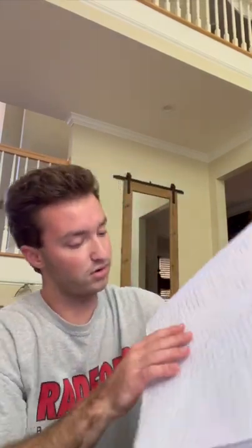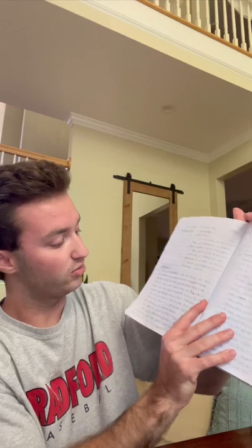And I wrote that this reaction was a precipitate reaction because a solid and a soluble liquid were formed from this, and it was an endothermic reaction. I also wrote the balanced equation for this, I don't know if you can see from this video: CuSO4 in the aqueous form plus Na2CO3 in the aqueous form yields CuCO3 in the solid form and Na2SO4 in the aqueous form.